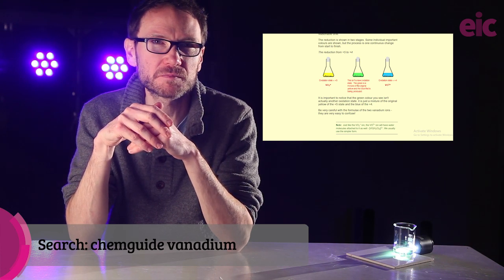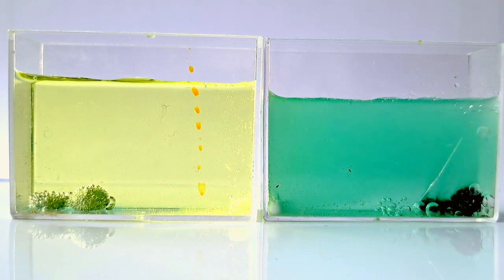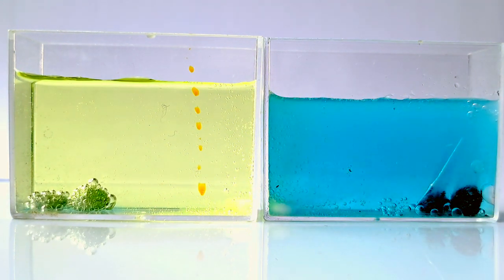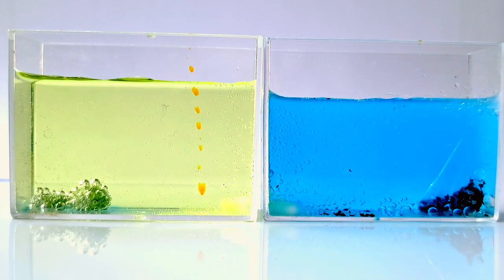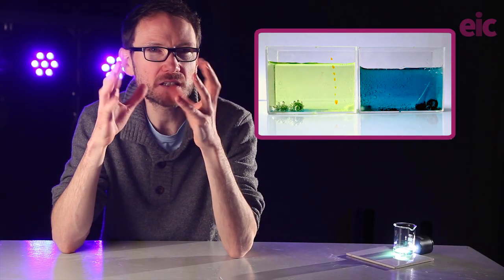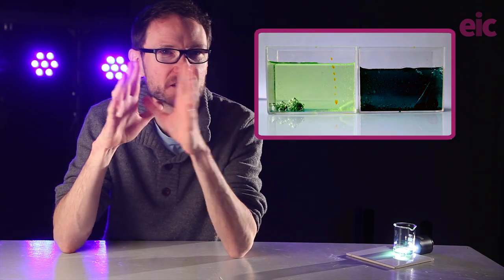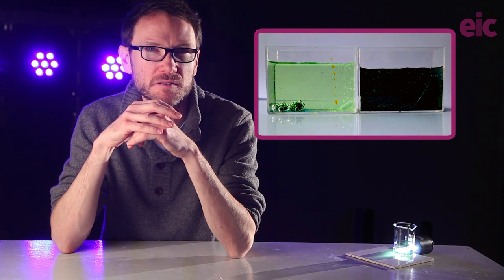The zinc granules on the left are untreated as I found them in the cupboard, and it's just painful to watch. Clearly, the surface has become heavily passivated, but it can be rejuvenated, as you can see on the right, with a little rinse in some dilute copper sulfate solution.